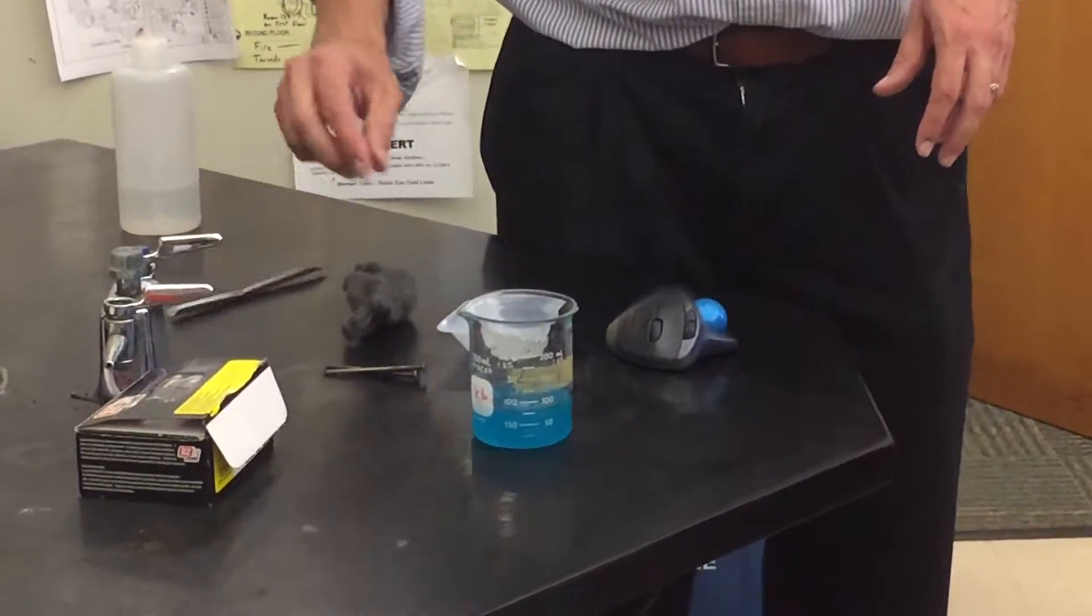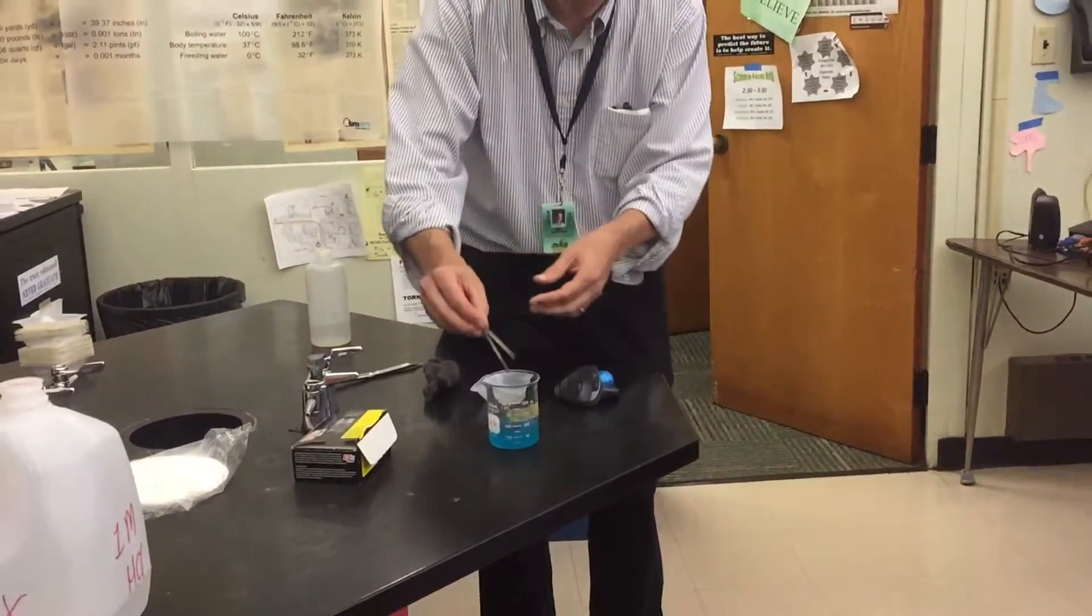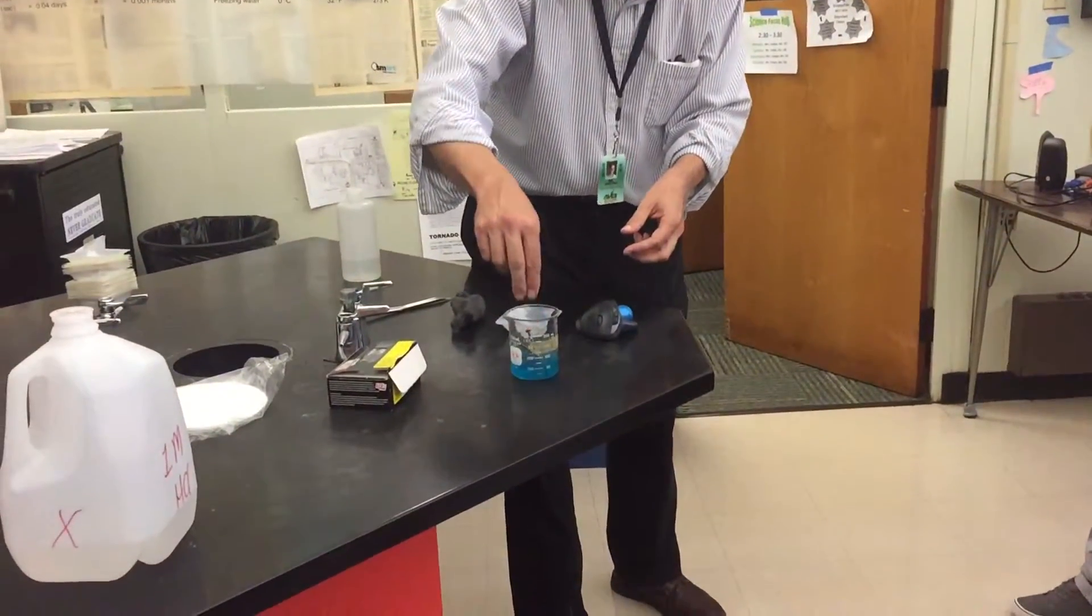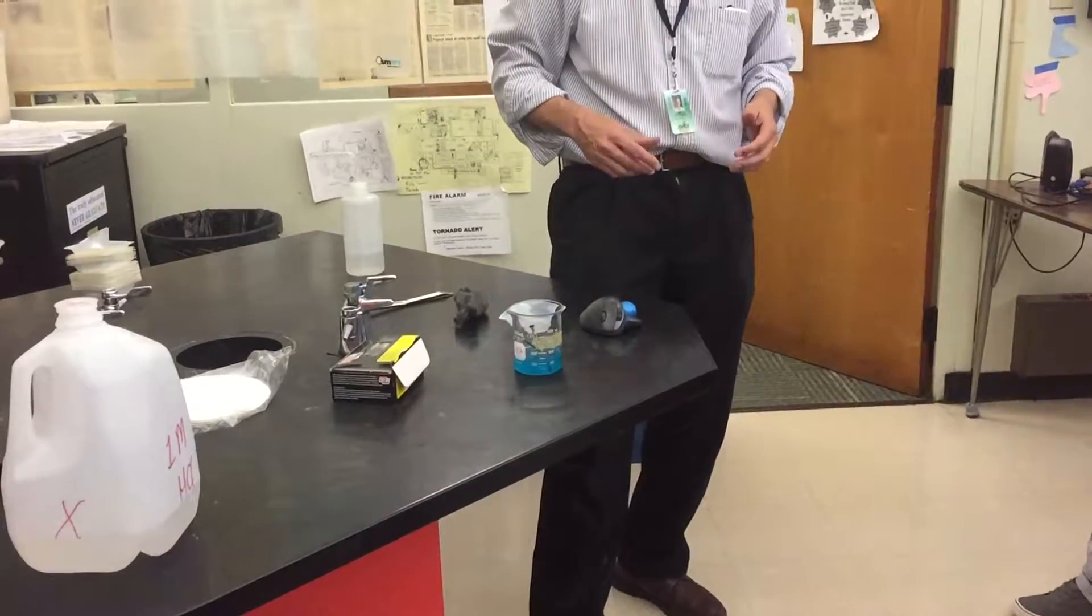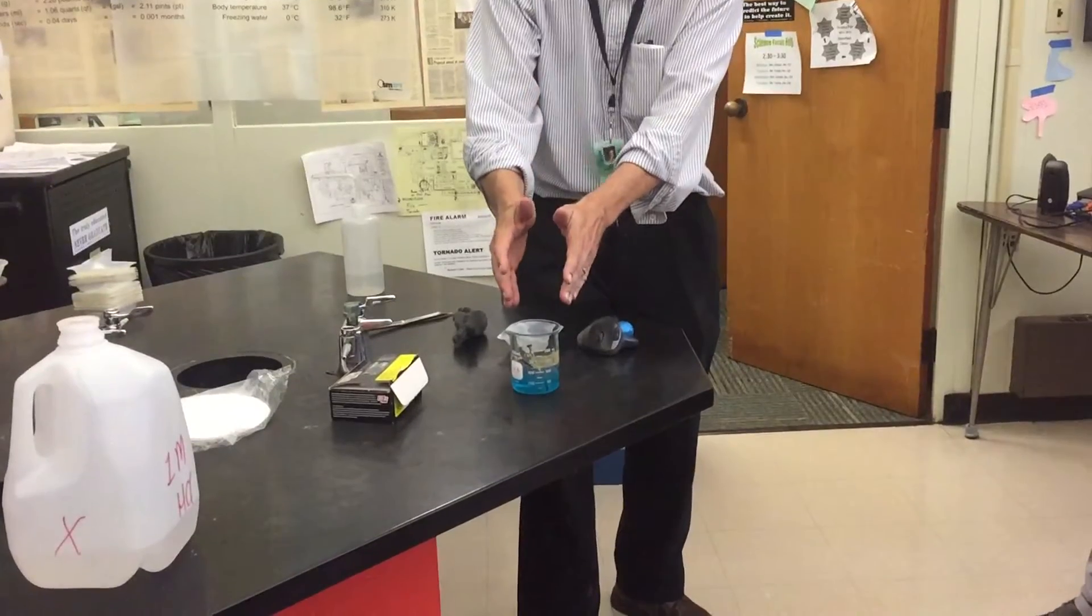So, that's good. Okay, so we have then gotten the exact mass of these clean iron nails, and we're going to put that in there, and it's going to wait for about 20 minutes. So, we've got iron with copper 2-chloride. Immediately.